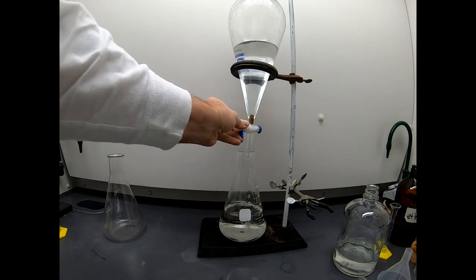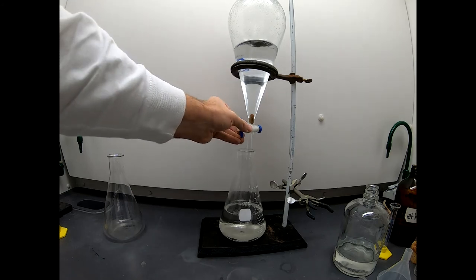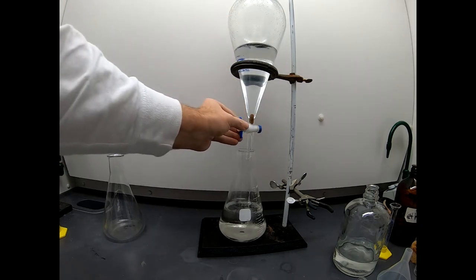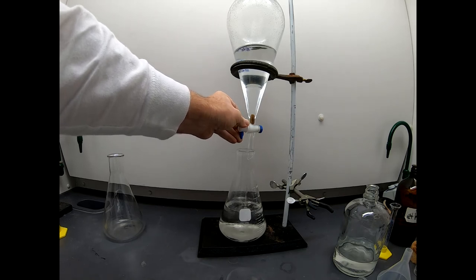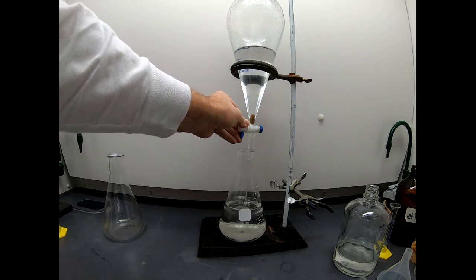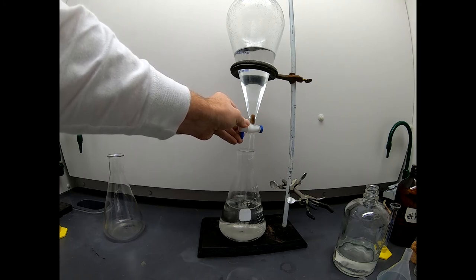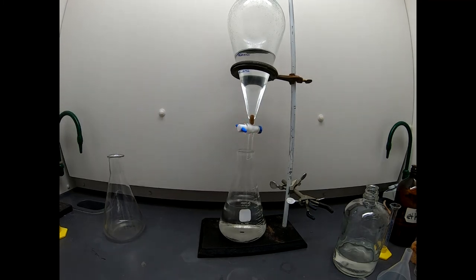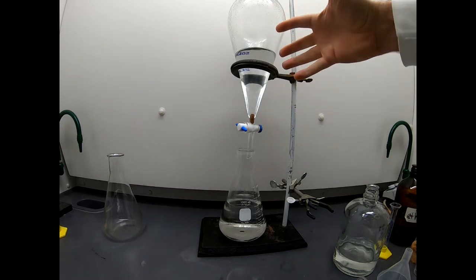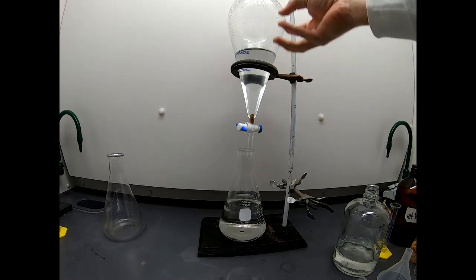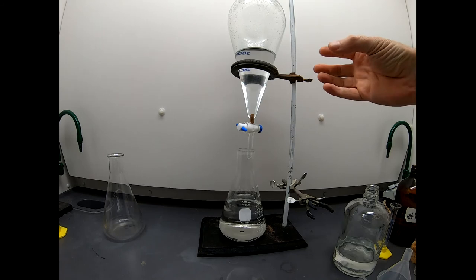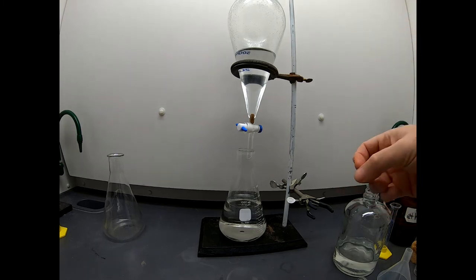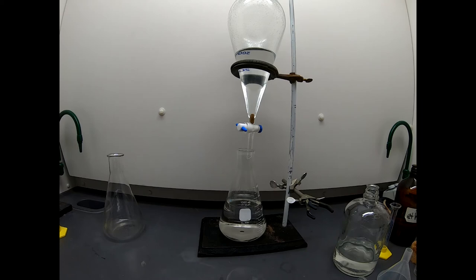Okay. Now let's let this drain down. Again, it won't be super fast. Here's our line. Now, you can move with the camera to see the line. But if you can move up and down, move your perspective up and down, it's a little easier to see if there's a separation there. Going great. I think it's a little clearer now. I won't get it all the way down there. Okay, great. Now, we don't have to show this on camera. I'm going to do this three more times. I'm going to rinse more and more water. What I'm trying to do is make sure none of that DMF is hiding in this ether layer. Where you get all that DMF out. And then once we do, ether is nice and volatile. We'll be able to evaporate the ether. And what will be left behind is our crude, hopefully pretty clean, product. So let's do this three more times. I'll do it off camera and then we'll come back.